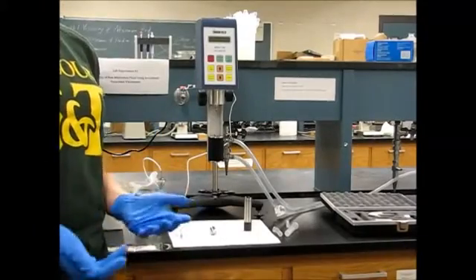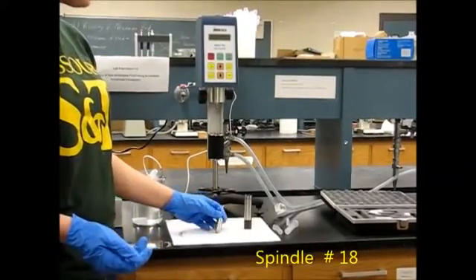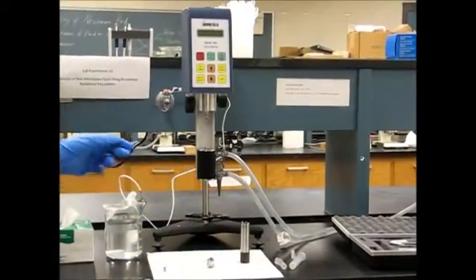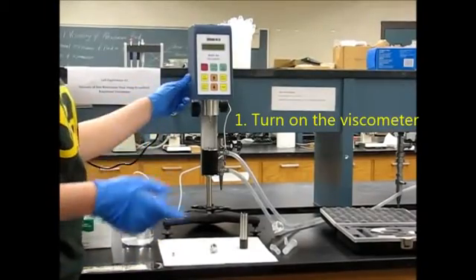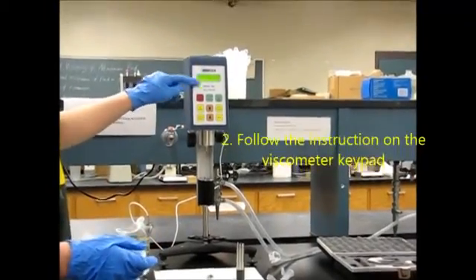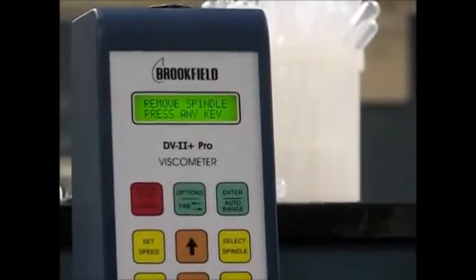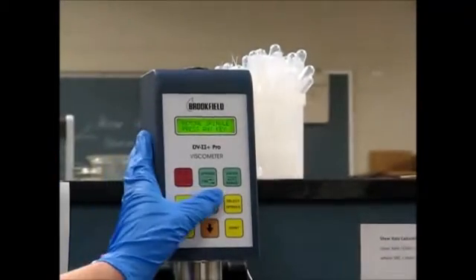For the purposes of this experiment, we're going to use spindle number 18 — it has an 18 on its stem. The first thing we're going to do is turn on the viscometer with the on-off switch on the back of it, and follow the directions on this keypad. It tells us to remove the spindle; we don't have the spindle attached, and then it says press any key, so I'm going to go ahead and press the key.